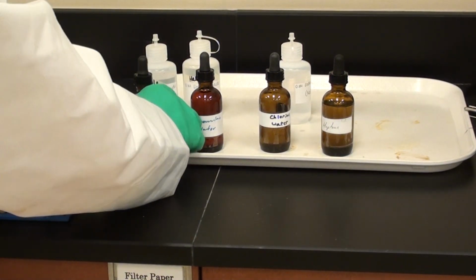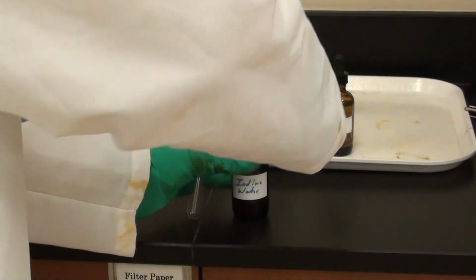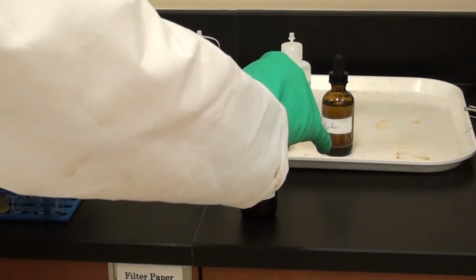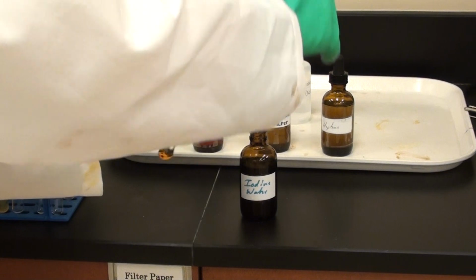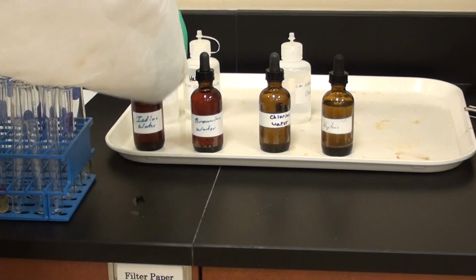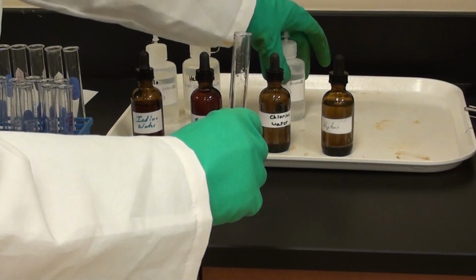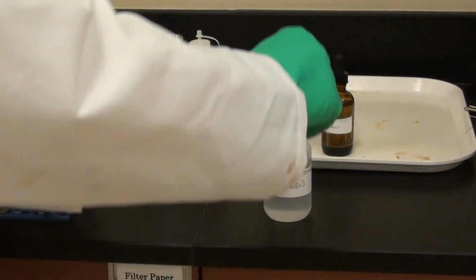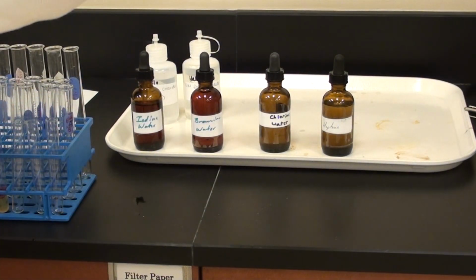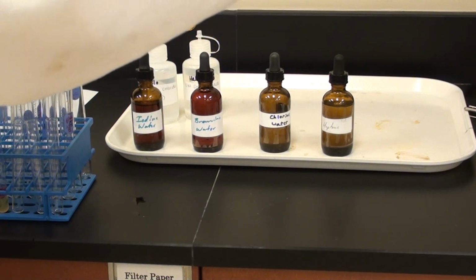Okay. All right, so now we're going to do iodine water with the sodium bromide. Again, I'm going to add a couple squirts. And I also want to point out, you really want to make sure you're wearing gloves when you're doing all of this. There's iodine water. And now I need sodium bromide. So last time I squirted in maybe 15 to 20 drops. I'll just do the same thing here. Squirt a little bit in. Good enough.